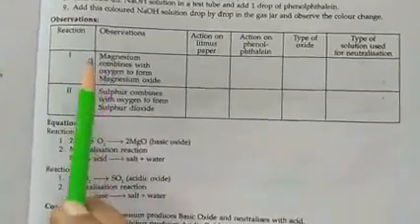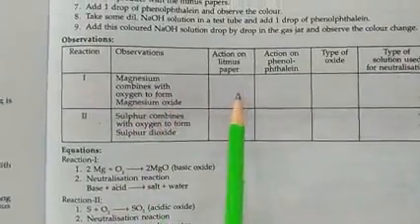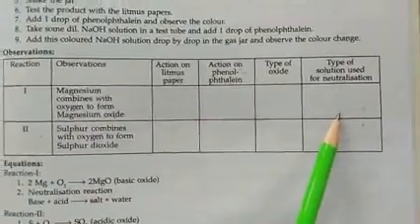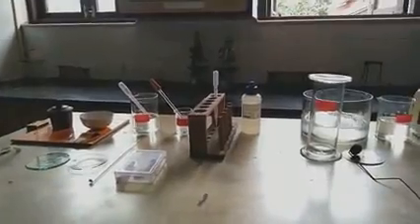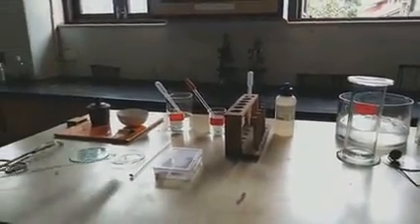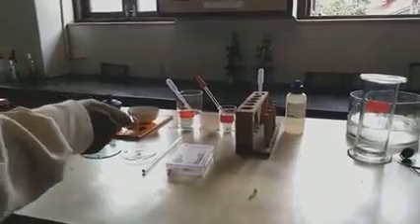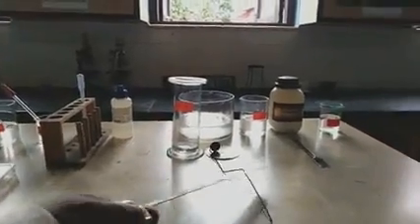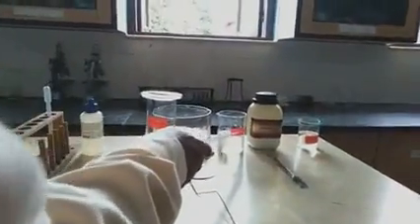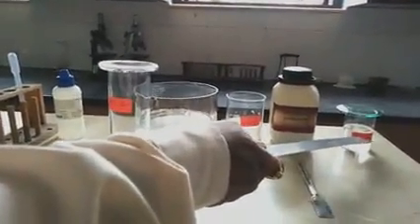Now let us start the first one — magnesium combines with oxygen to form magnesium oxide — and fill all four parts. For this experiment you will get: spirit lamp, pair of tongs, glass lid, watch glass, glass rod, litmus papers, magnesium ribbon, water, acid, dropper, phenolphthalein indicator, gas jar, deflagrating spoon, spatula, sulphur powder, and sodium hydroxide solution which is a basic solution.